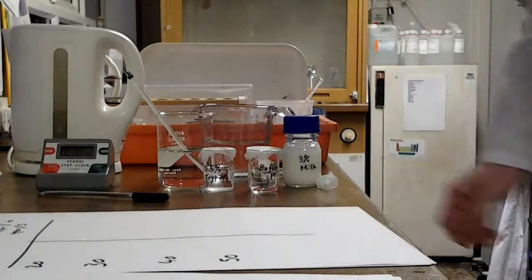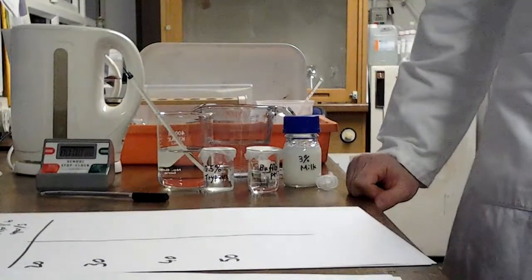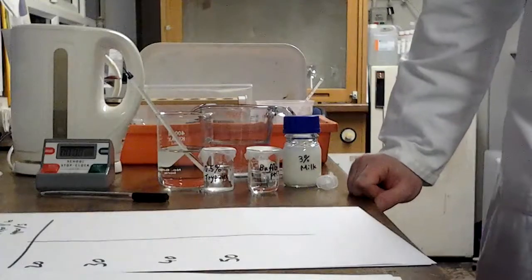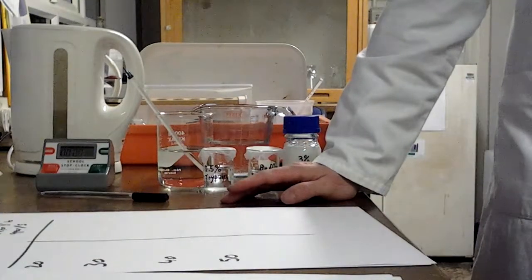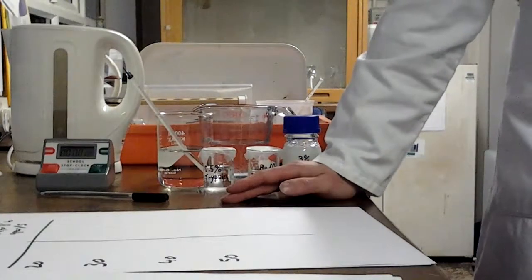Hello folks, here's a short video all about required practical number 1. Now the title of this practical is an investigation into the effect of a named variable on the rate of an enzyme controlled reaction. But specifically, that named variable is going to be temperature.